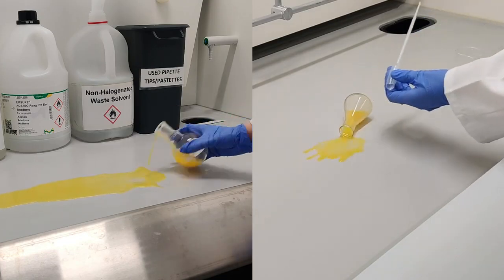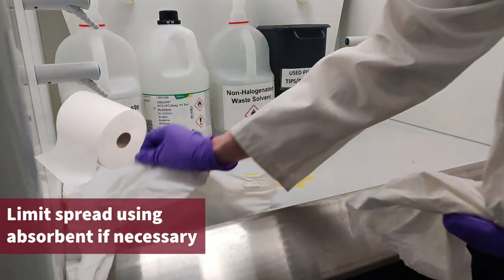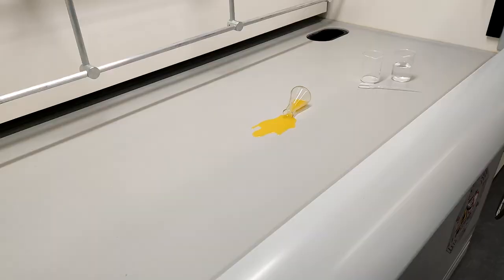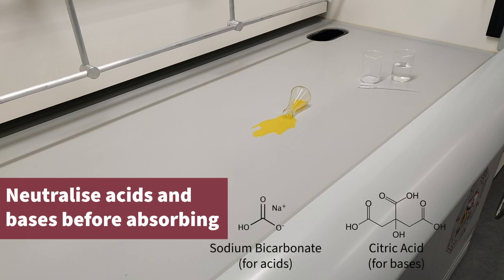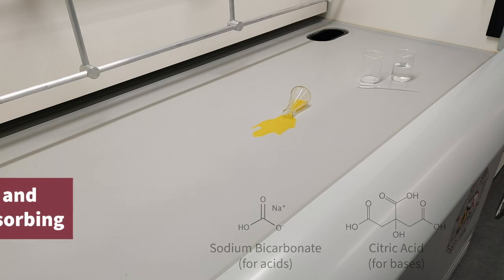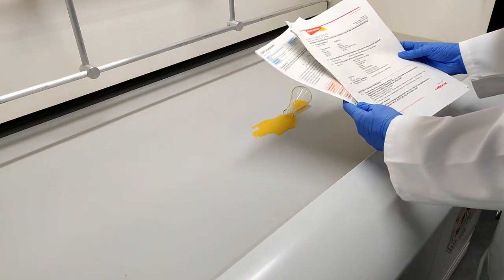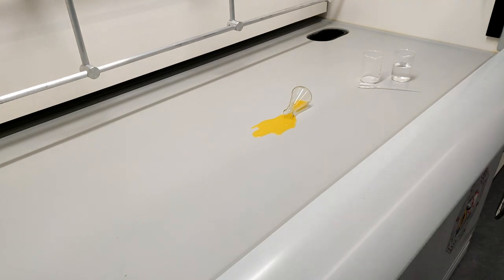To clean up a minor liquid spill, first limit its spread, for example by using a paper towel or spill pad. Decide whether the liquid can be simply absorbed or if it should be neutralized, for example using sodium bicarbonate for acids and citric acid for bases. Also, check if there is any danger from contact with water. The identity of the spilled liquid should be found using the container label or COSH form.